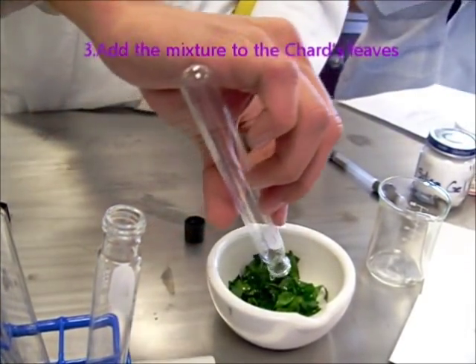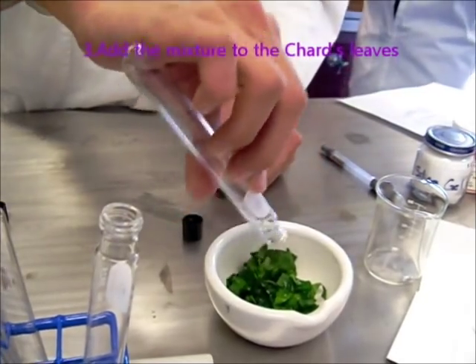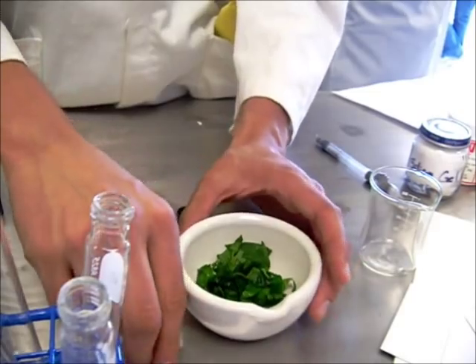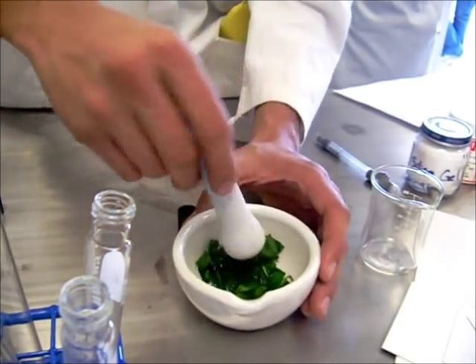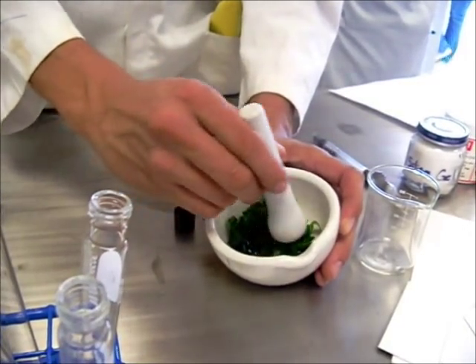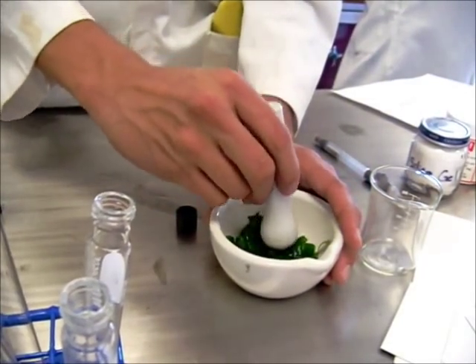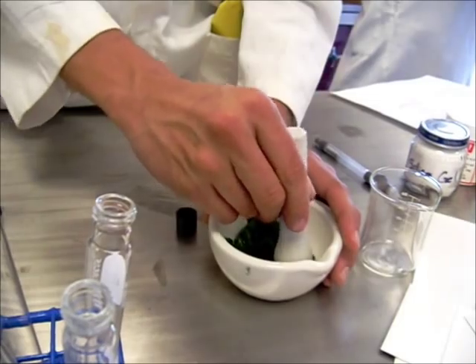Next, add the mixture to the chard leaves. Next, the chard sheets are crushed, taking care of not getting paste.